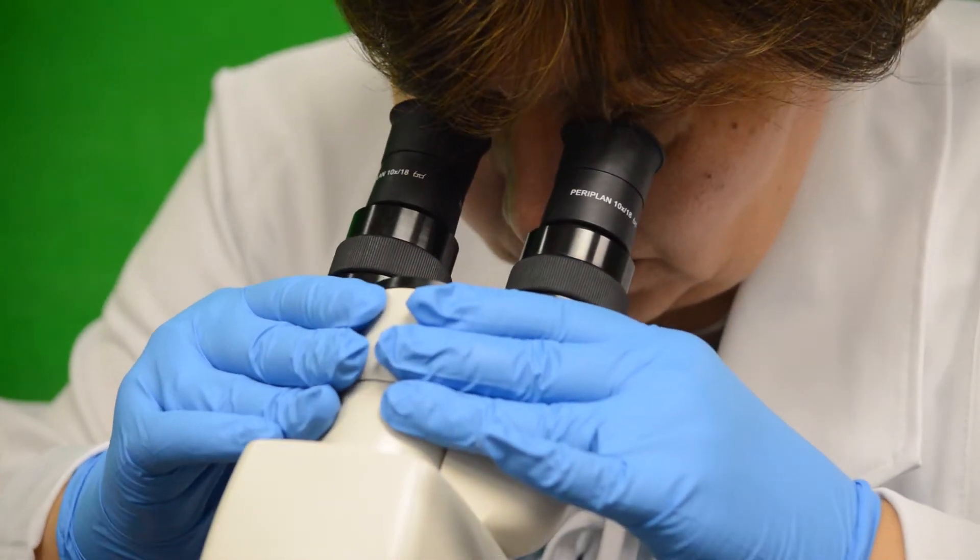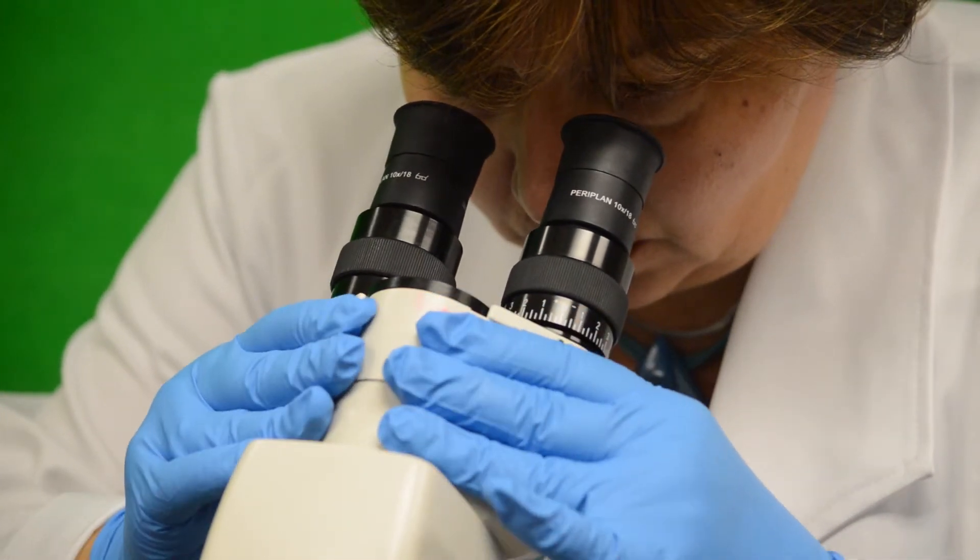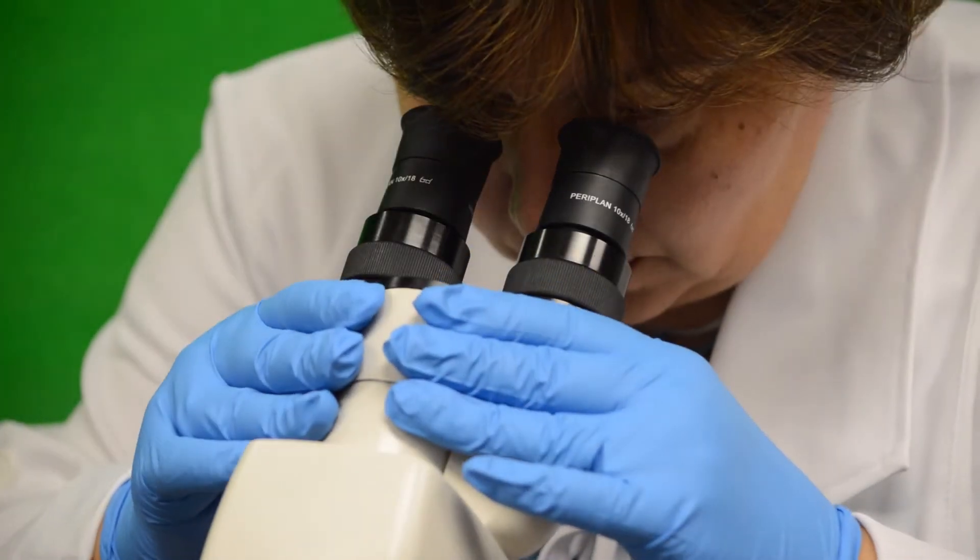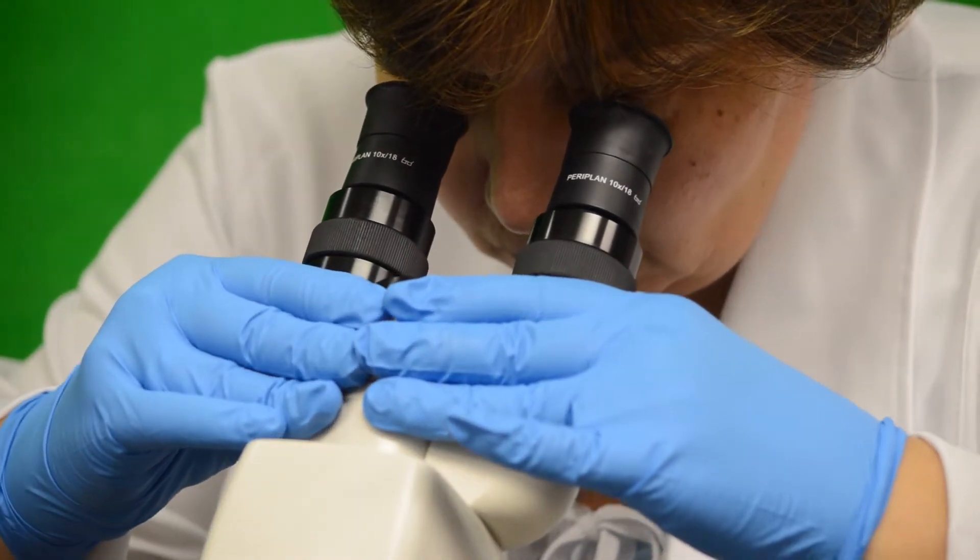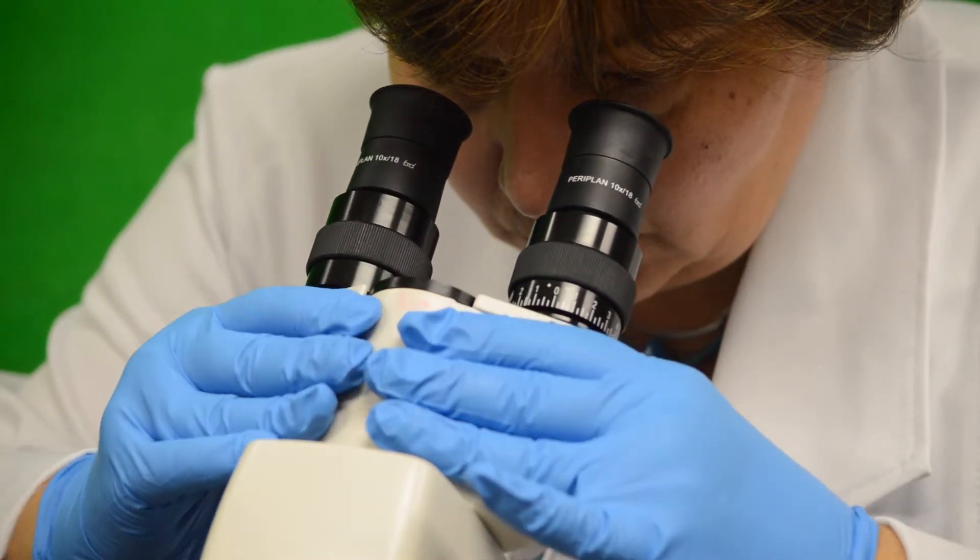Before you start using the microscope, make sure that the distance between the lenses is comfortable for your eyes. You may adjust the lenses to accommodate your eye width and visual focusing power by moving the oculars closer together or farther apart.